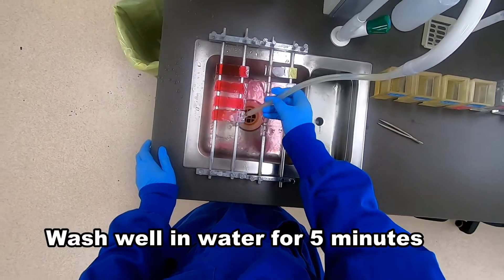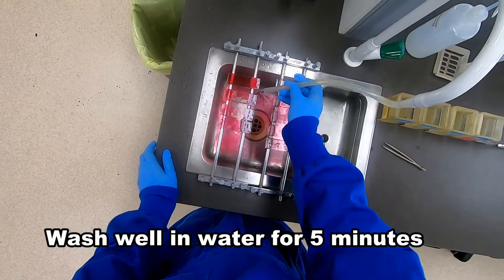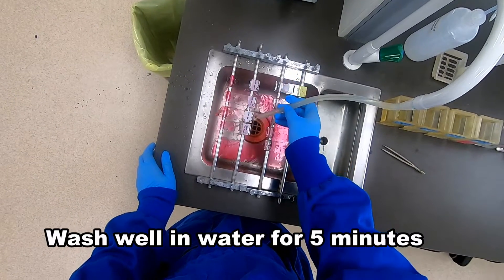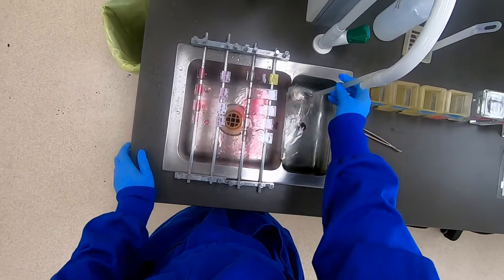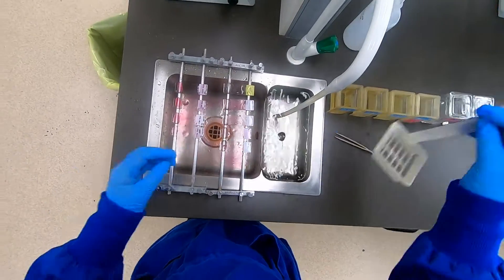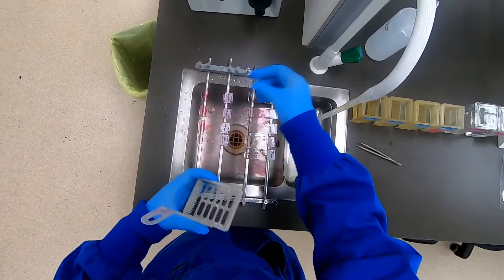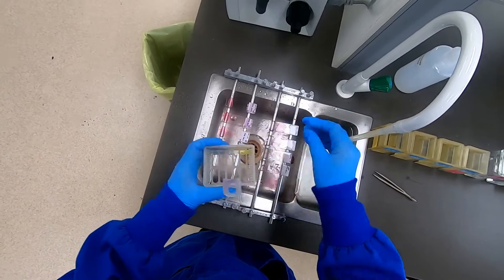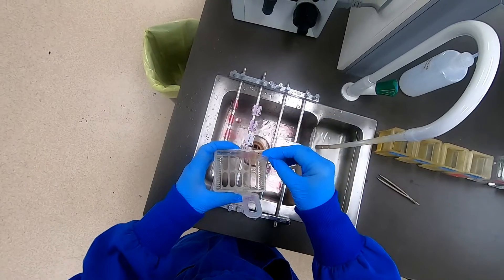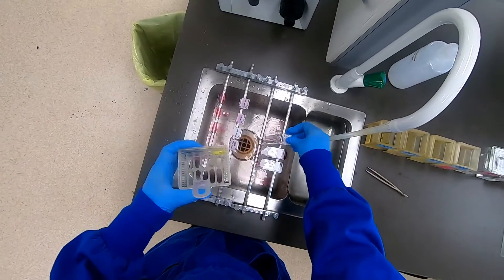Once stained, we rinse the slides well. It's quite important to do this step thoroughly by placing the slides into a rack such as this and then leaving the water running in the sink for about three to five minutes.